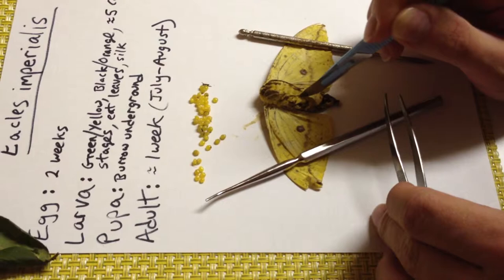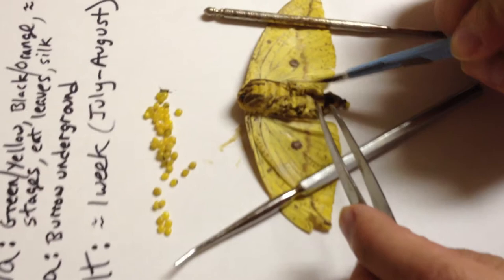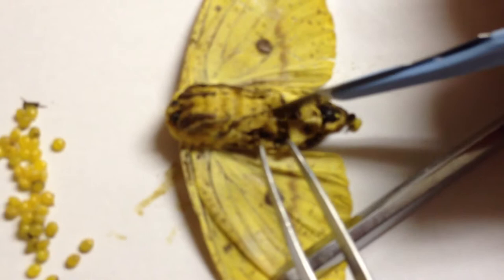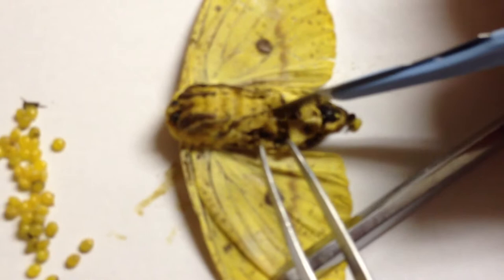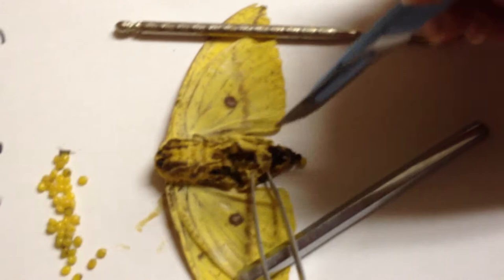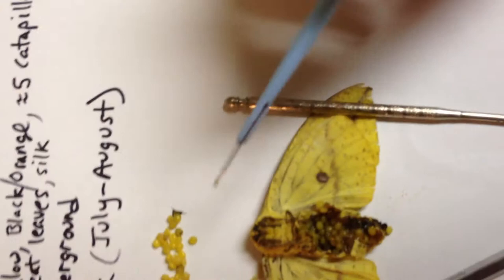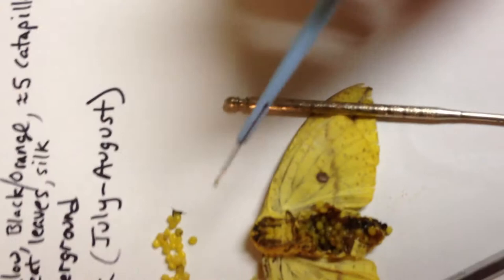It's just breaking apart. There is an odor coming out of this — I'll just pull away — look at that, there's a whole bunch of eggs in there. I couldn't cut properly because the material was just so soft. But look at how many more eggs are inside — maybe the moth died too early. There's so many more eggs, it is full of eggs. When they said on the website approximately 200 eggs, we've got about 50 out here and there's got to be at least 50 or more stuffed in here — this whole body is just full of eggs.